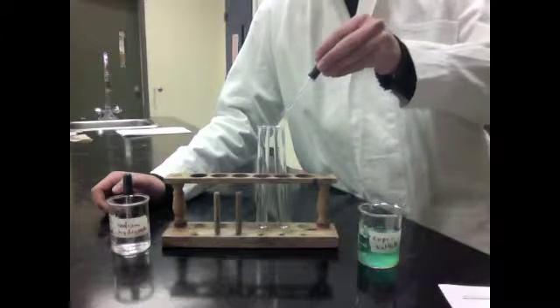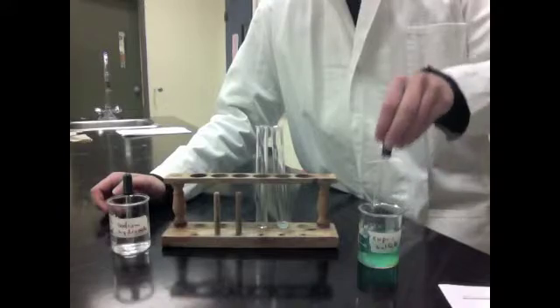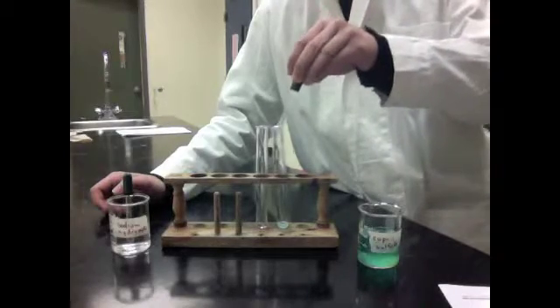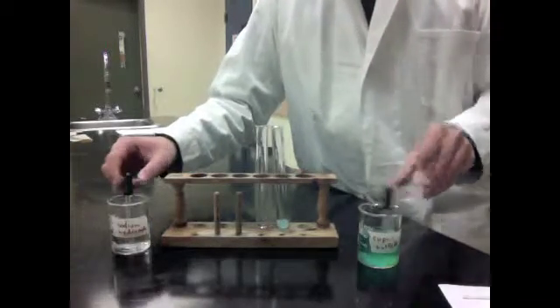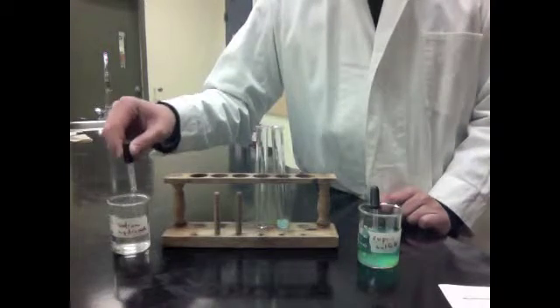And then another two eye drops into the other test tube.